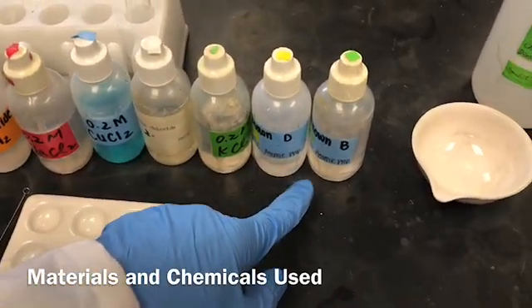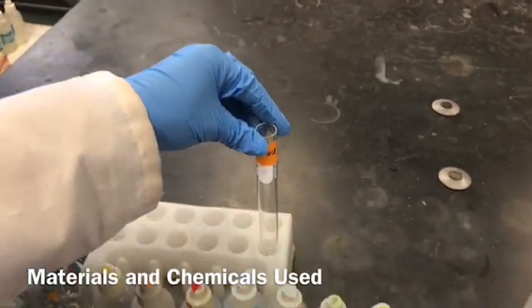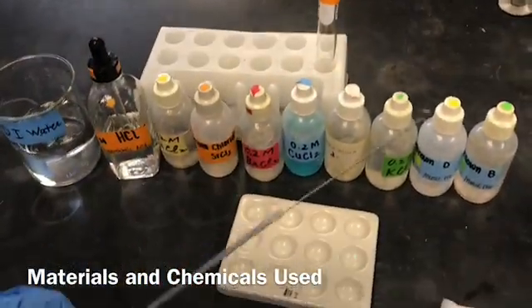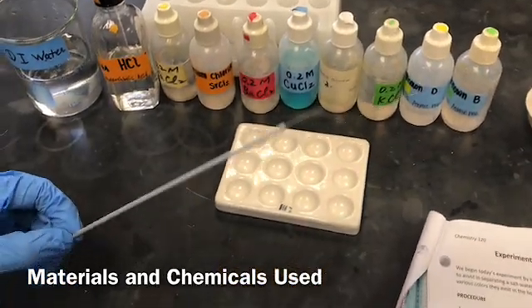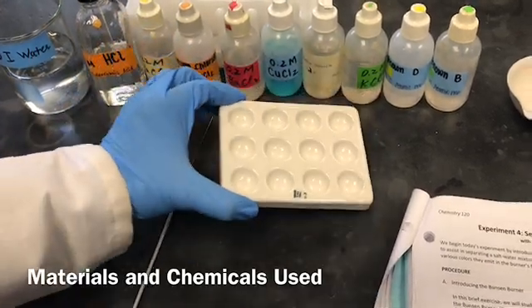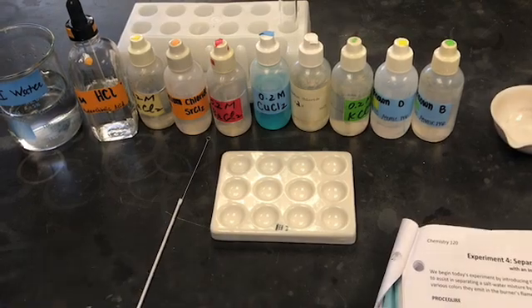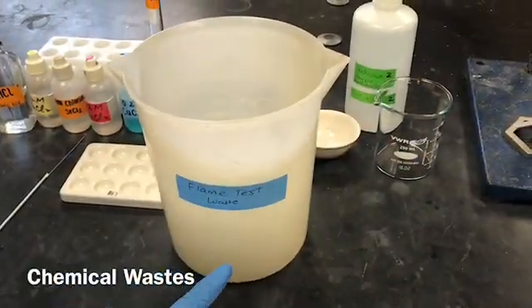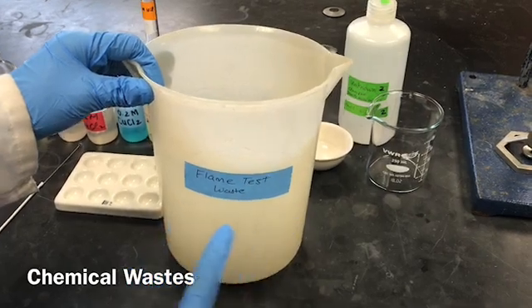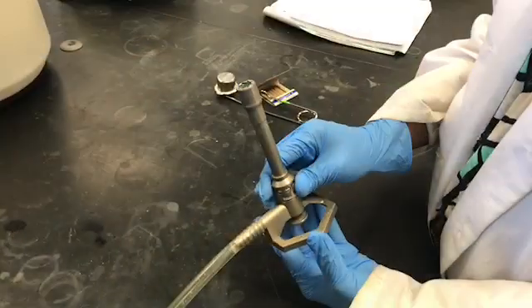There are many unknowns, but here we are using D and B. You will need a test tube to hold the 1 molar HCl to clean the wire. This is the test wire for the flame test. You will also need a spot plate to contain your different solutions and a waste beaker to dispose of all waste from the flame test.